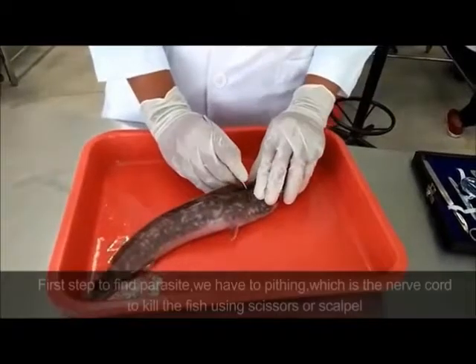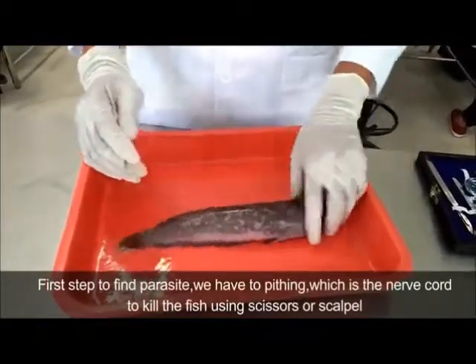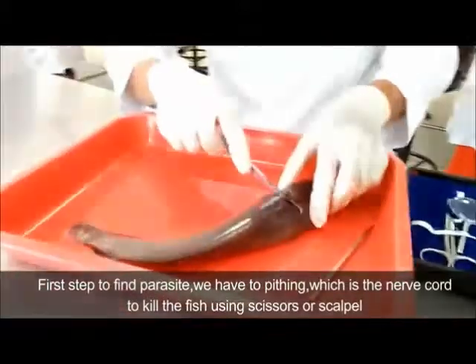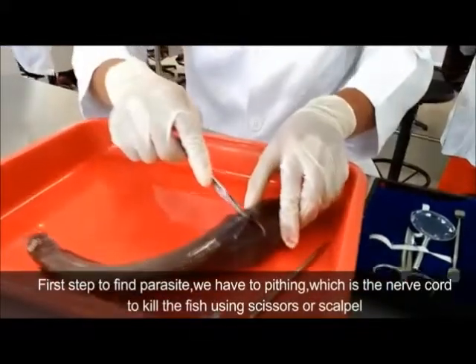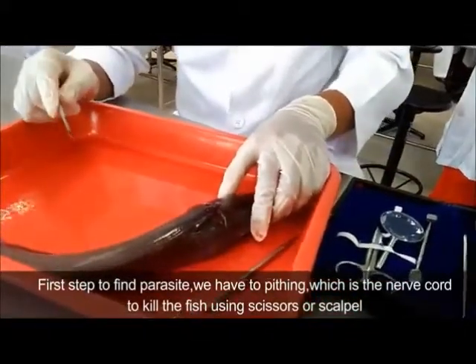The first step to find parasites: we have to do pithing, which is cutting the nerve cord to kill the fish using scissors or scalpel.